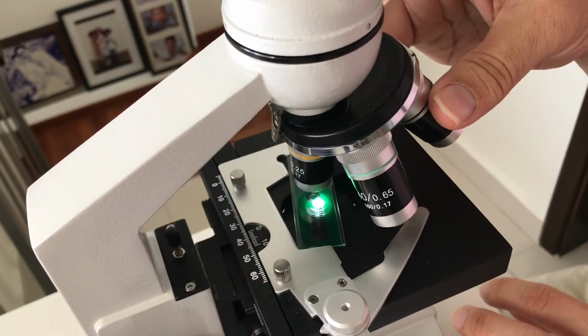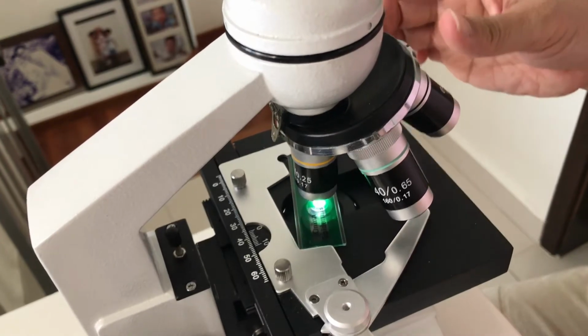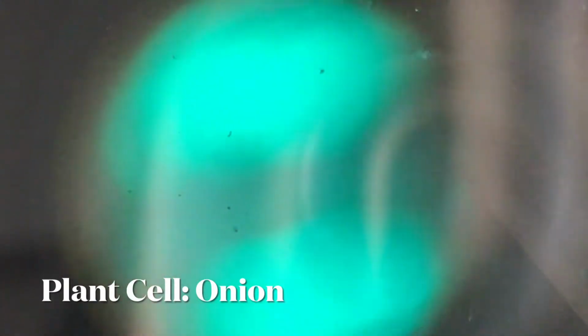Usually we start with the lowest magnification before we move on to the higher ones. Once you put your slide under the microscope, you're likely to get a blurry image. So you need to adjust the big focus knob to get the image into view first.